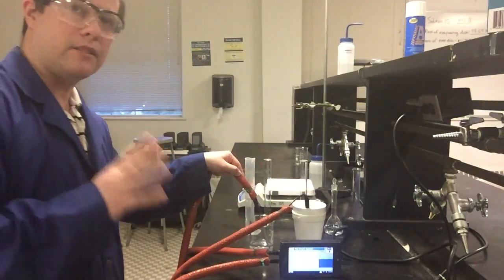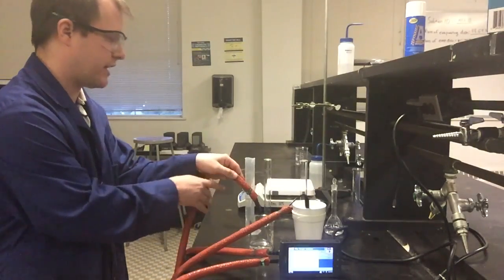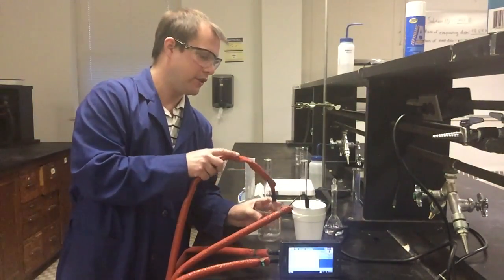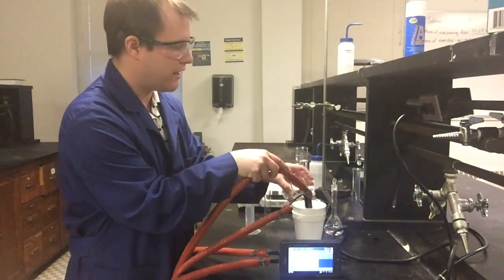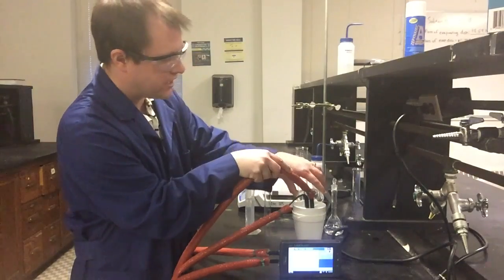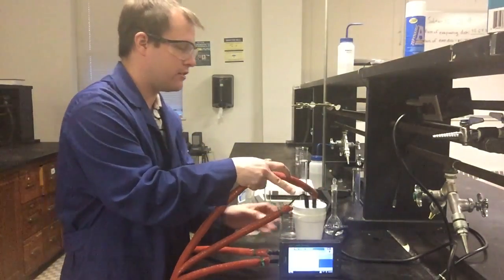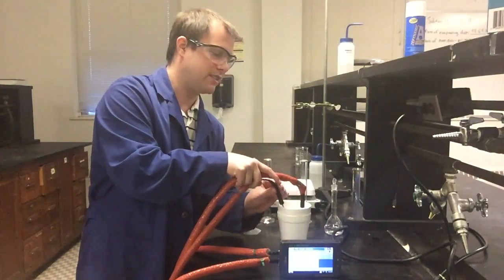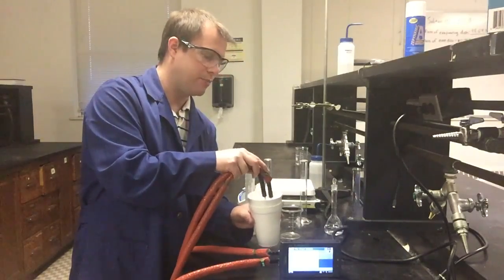All right, so I'm about 10 seconds away from that 300-second midpoint in all of this, and so I'm just going to be very careful moving things over here. So I'm going to go ahead and move my first thermometer over and add, in this case, my base solution to my acid. Again, which one you add to which doesn't really matter. I really just want to make sure they're both staying in the styrofoam cup. And so here I have my styrofoam cup that I have both of my thermocouples in.